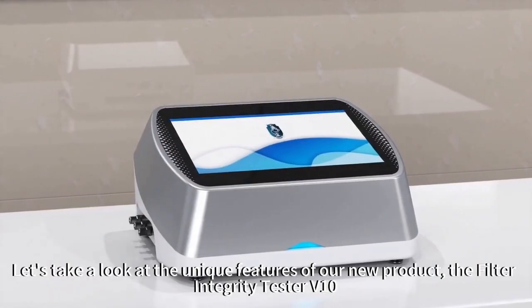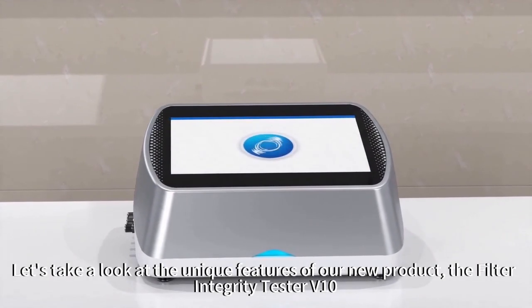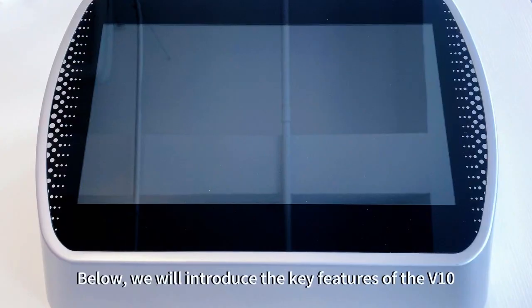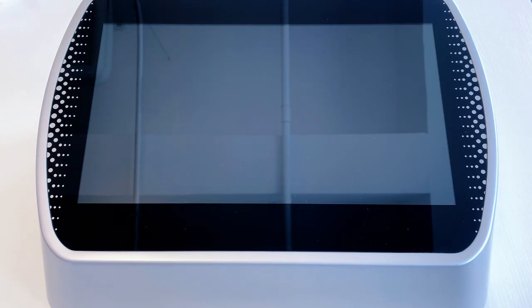Let's take a look at the unique features of our new product, the Filter Integrity Tester V10. Below, we will introduce the key features of the V10, as well as its unique advantages in data integrity and compliance with EU GMP Annex 11 computerized system validation.